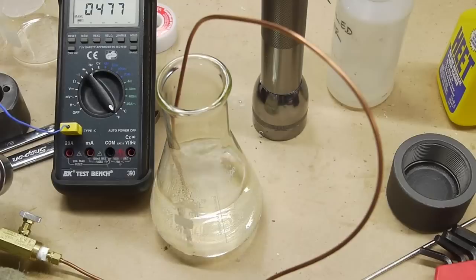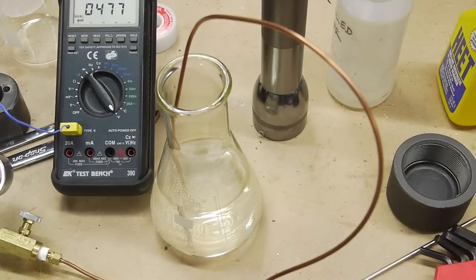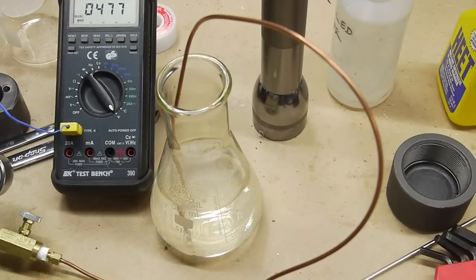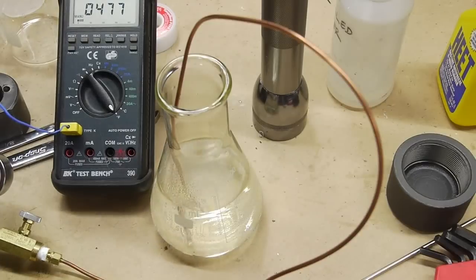If you have a slow leak in the chamber, there's going to be a lot of methanol vapor coming out. And we're indoors here, so that could be a problem. Originally I thought quite a bit about how to heat the chamber the best way. I thought about putting it in a toaster oven because then I could control the temperature of the air inside the toaster oven very accurately. But I decided against that idea because it's a very small volume inside the toaster oven.